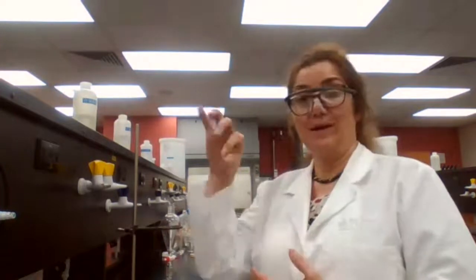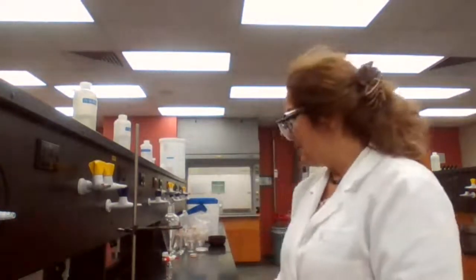Because it is soluble in water. In order to do extraction, you must have 2 layers, and if the 2 layers don't form, you cannot do extraction. So you have to make sure that your organic solvent, alcohol is an organic solvent, it can dissolve many of the organic compounds, but it is not going to separate into 2 layers, so we cannot use alcohol.